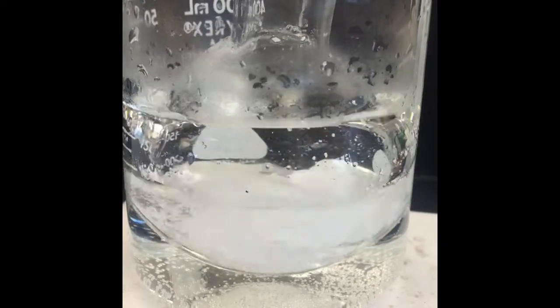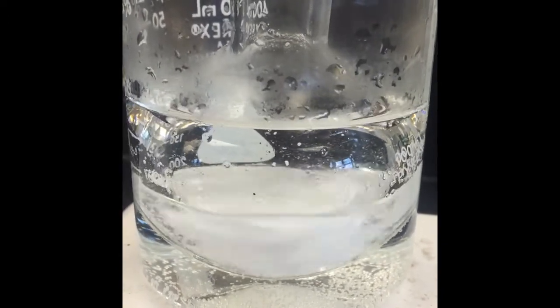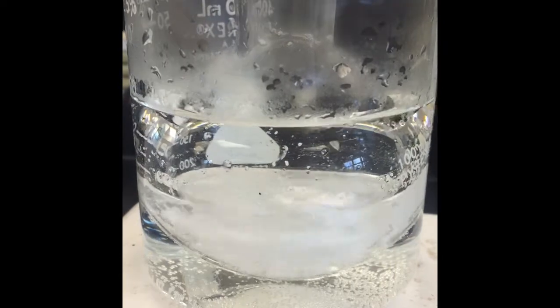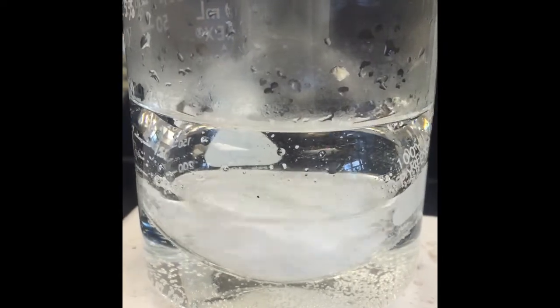Stuff is still warming up but the solid is starting to dissolve. We can stir.